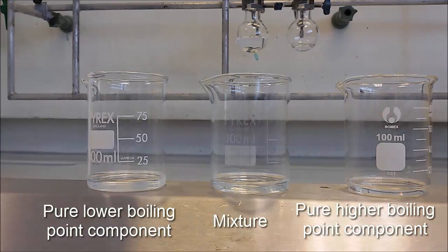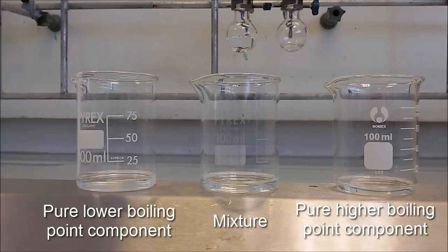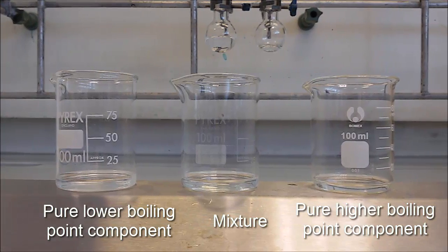The three beakers contain the first component, mixture, and the second component, respectively.